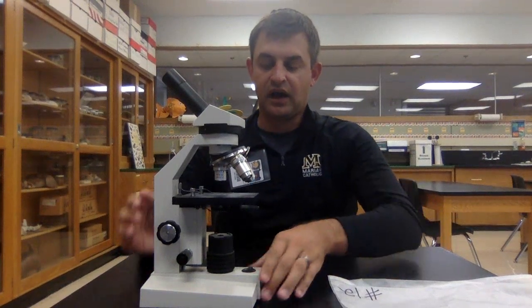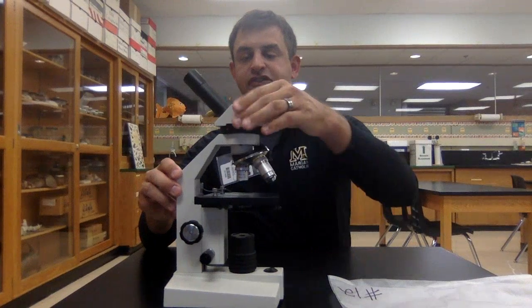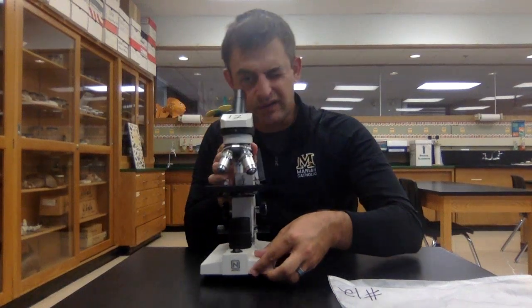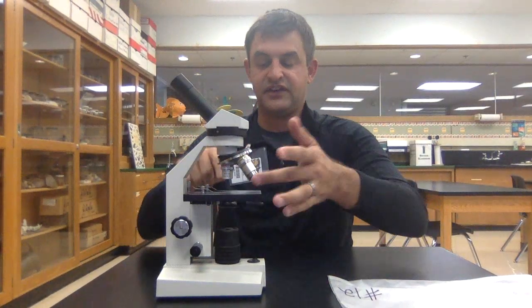I'll try to point out these features as best I can. We'll start up here with the eyepiece. The eyepiece is where you would look through to see the specimen. Many of our microscopes, when you look through the eyepiece, also have a black pointer that allows you to focus on a particular part of the specimen that you're looking at. That can be really useful when you're trying to focus an image on the stage.